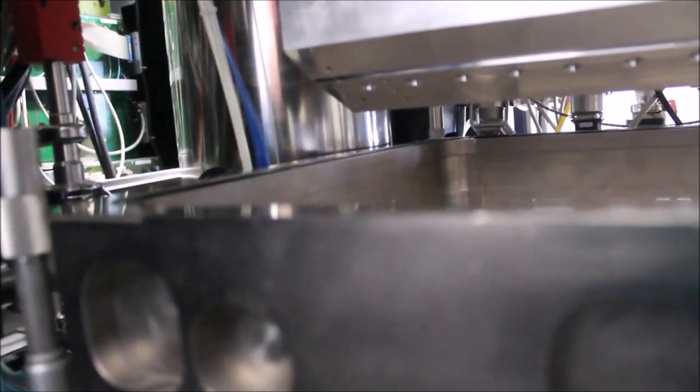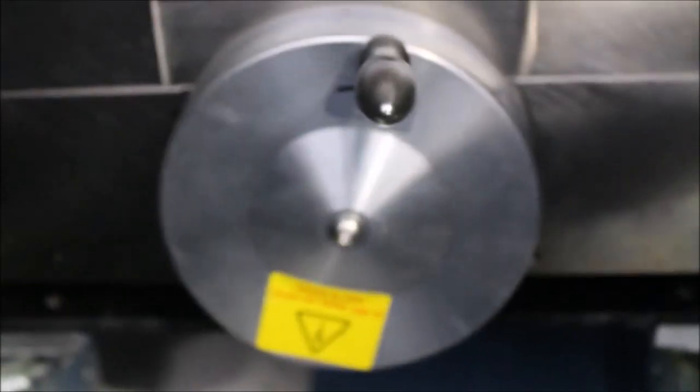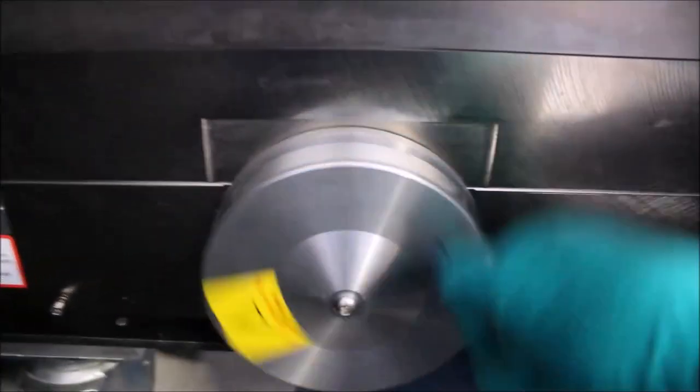Let's sit here and make sure that all these little sump cables are extending the way they're supposed to. Let's zoom in over there. That one looks good. And that one looks good. Things are going okay. Sometimes it's helpful to have an assistant watching the cables in the front while you crank up in the back. We got all our nice little nuts clamped here and in place just like we want them. And in front as well. Right where we want it. Now our job is to crank up the sump.